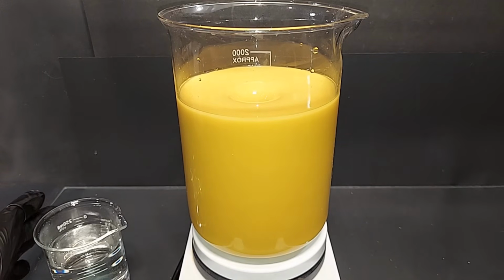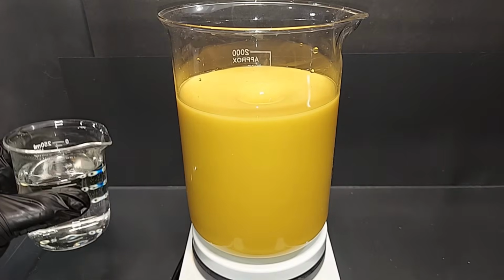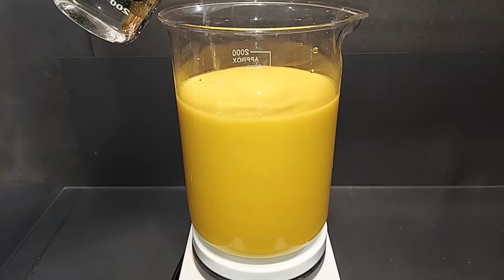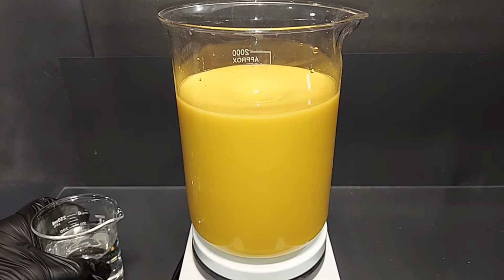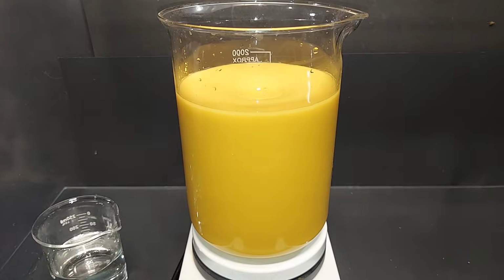So I'm going to start adding the ascorbic acid. We do have a nice yellow color. Normally, if you have more of a brown color, you're more worried about the iron 3, but there's definitely some in there. So I'm going to add maybe half of the ascorbic acid, and then maybe save the other half, because as we go, and depending on how long it takes to get to the vacuum filtration, this solution can again form more iron 3.